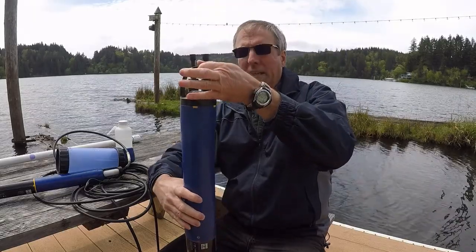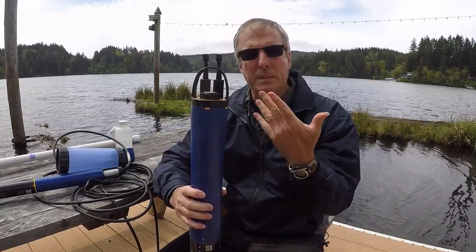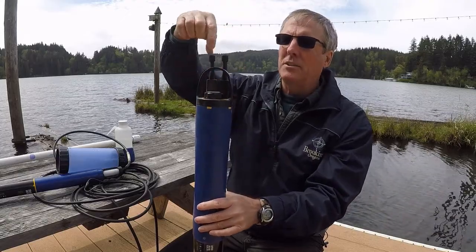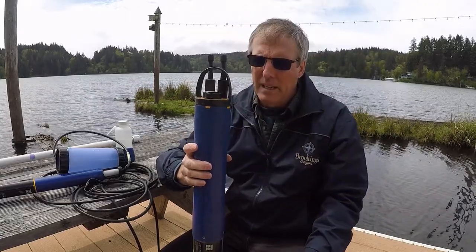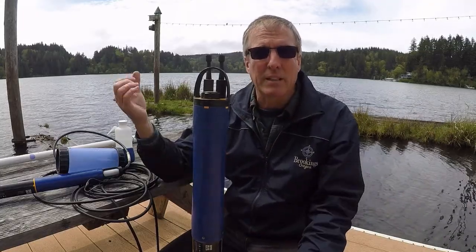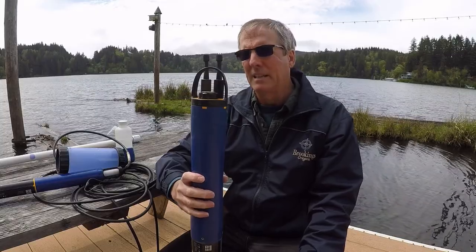The tricky part is if you're in, let's say, a 70-foot depth lake like Eel Lake, you can deploy this, but then how do you get it back again? You could attach another rope and have it go up to the surface with a float up there. The problem is that unless you're able to monitor that, somebody can come along and see the float, be curious about what it is, think it's a fish trap or something, and just pull it up. Well, now somebody has your $10,000 piece of equipment in their hands.